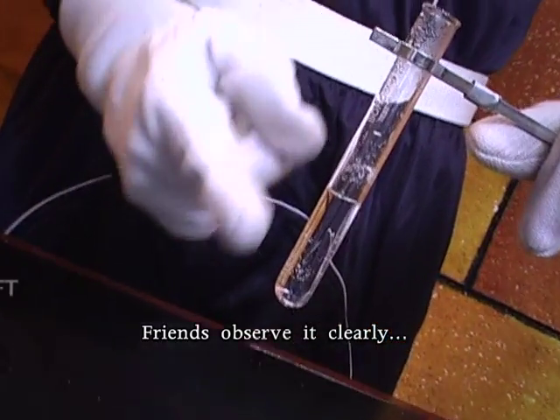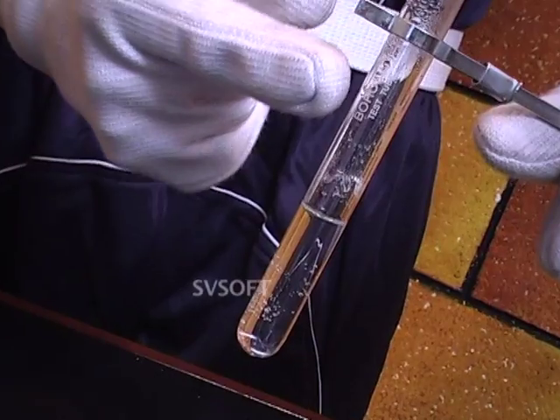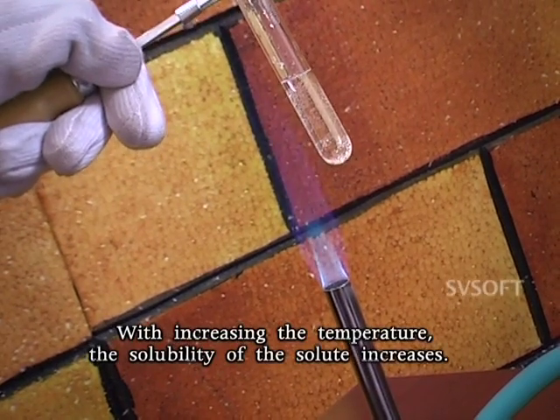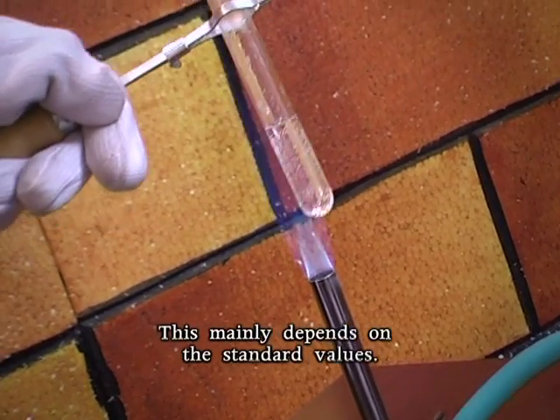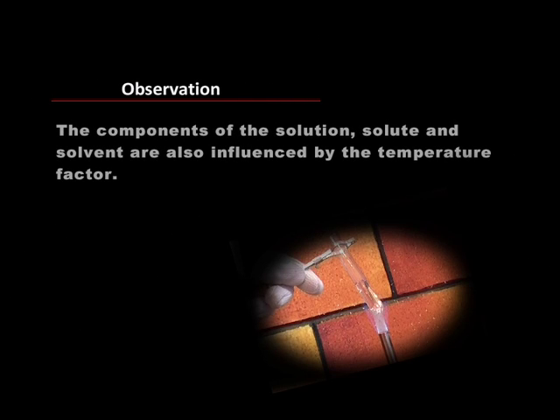Friends, observe it clearly. Salts get separating from the water. Do you know the reason? It is because of the temperature effect. With increasing temperature, the solubility of the solute increases. This mainly depends on the standard values. The components of the solution, solute and solvent, are also influenced by the temperature factor.